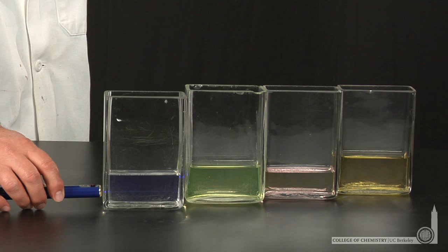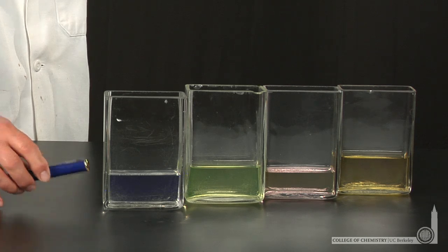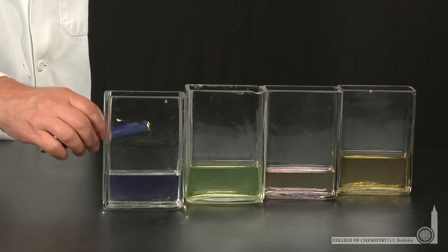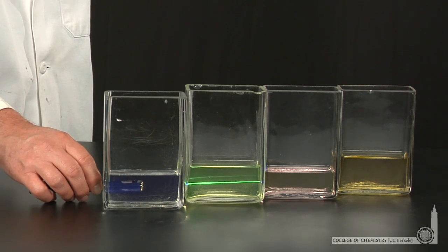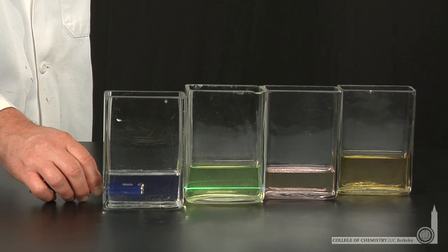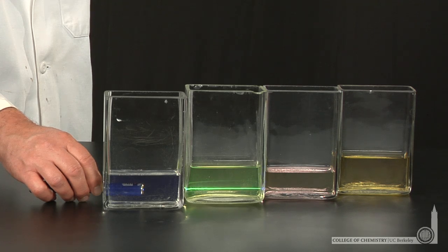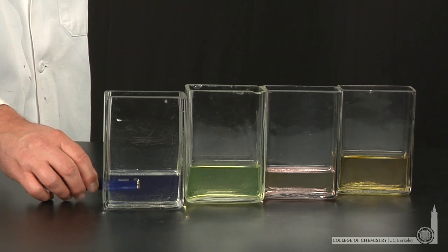So here, the blue laser is transmitted through the blue solution. But blue photons are absorbed in the next solution and photons in the green are emitted.